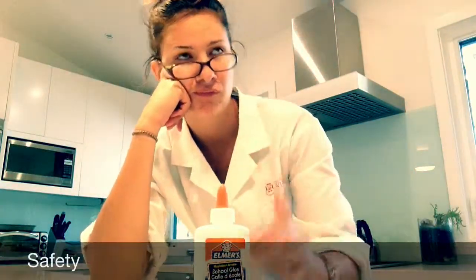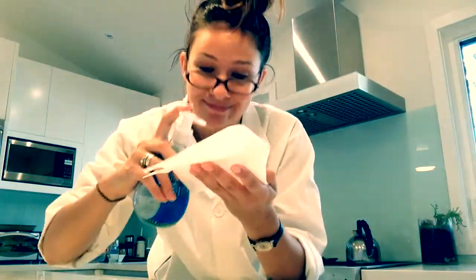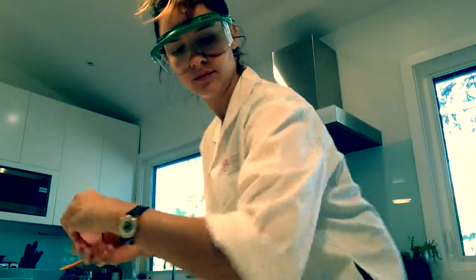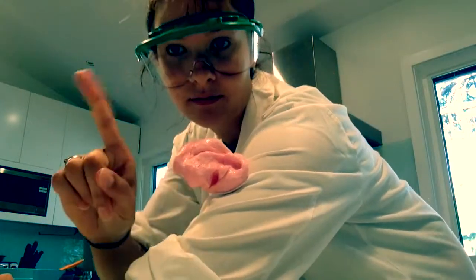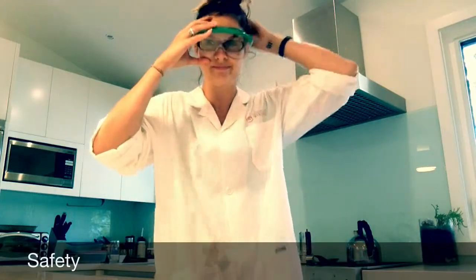During an experiment, never put anything in or near your mouth. After an experiment, always clean your workstation thoroughly. The GAC will stick to cloth, so be careful around your clothing. And last but not least, protect your eyes whenever doing an experiment.